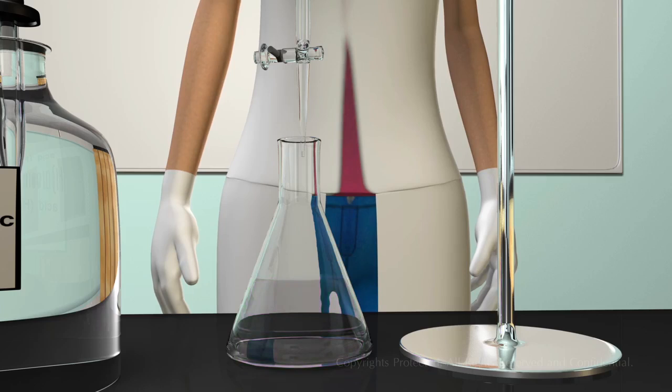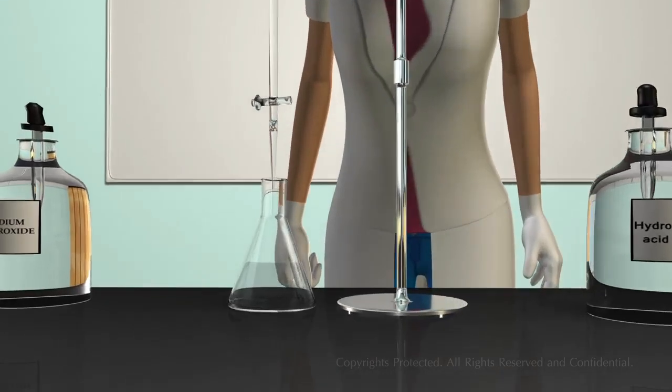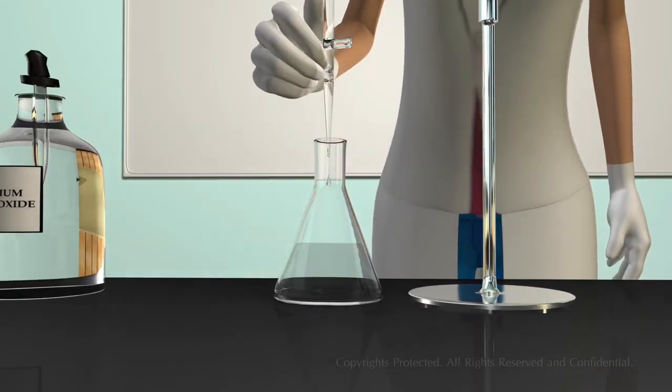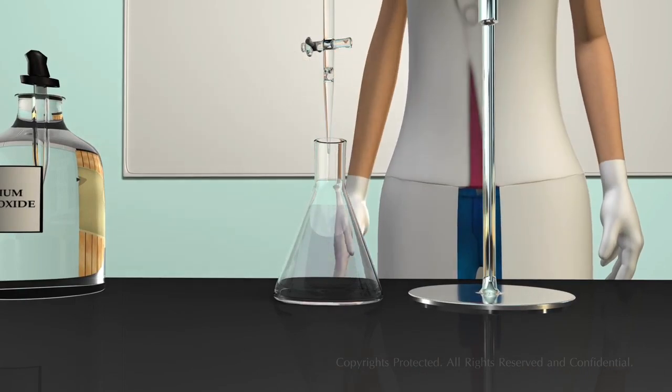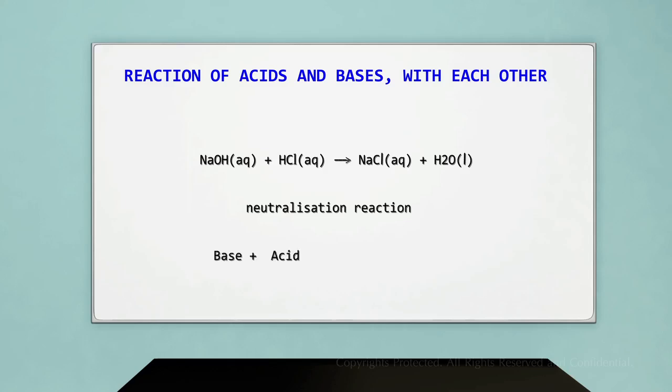Let us again place the conical flask underneath the burette containing sodium hydroxide. You can see that the pink color appears again, which gives us the conclusion that the solution is now basic. Let us look into the chemical equation of the above experiment. Sodium hydroxide plus hydrochloric acid gives you sodium chloride plus water. The reaction between an acid and a base to give a salt and water is known as a neutralization reaction. In general, a neutralization reaction can be written as base plus acid gives you salt plus water.